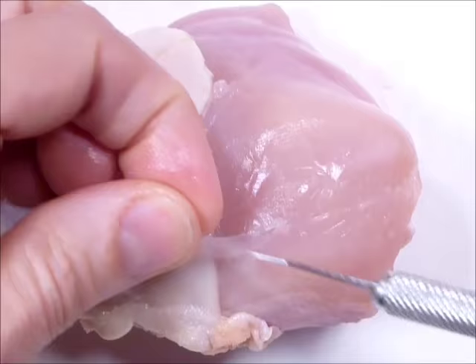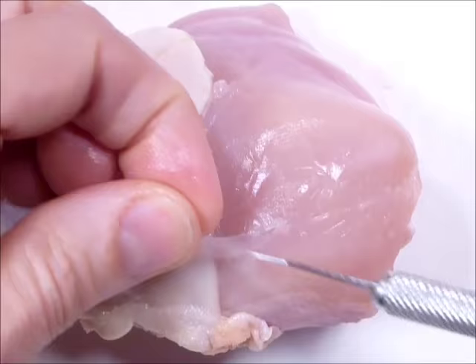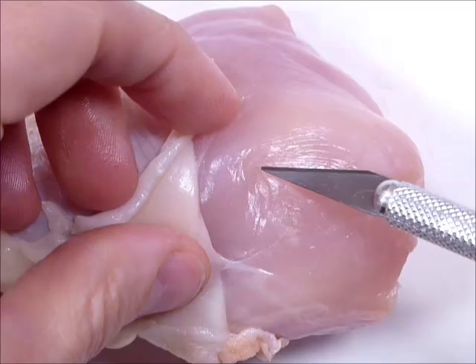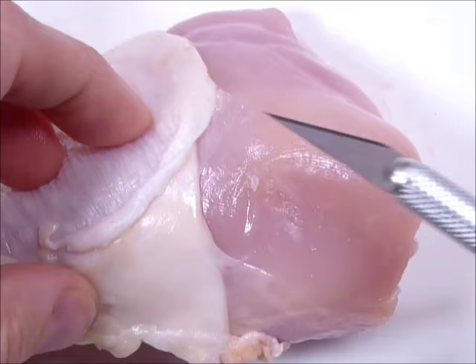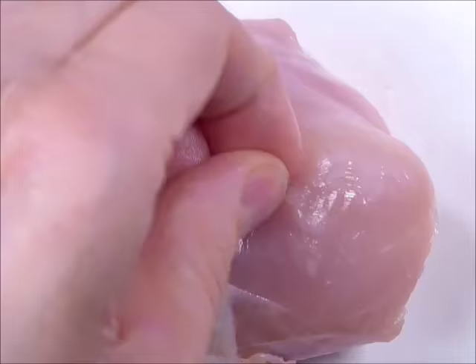This one might be the layer — the bag — that goes around the whole thing, so this particular muscle would have its own bag. Because when you get the bag off, the actual muscle won't look shiny. Once you get the connective tissue off, the actual muscle will look rather dull.